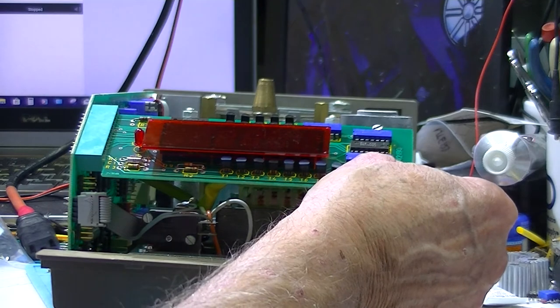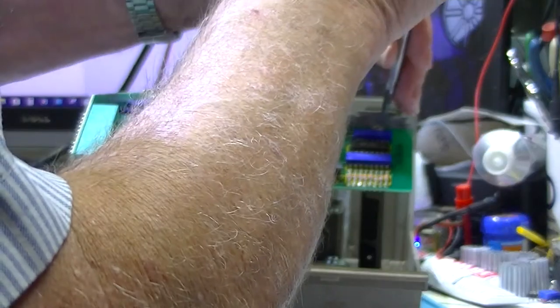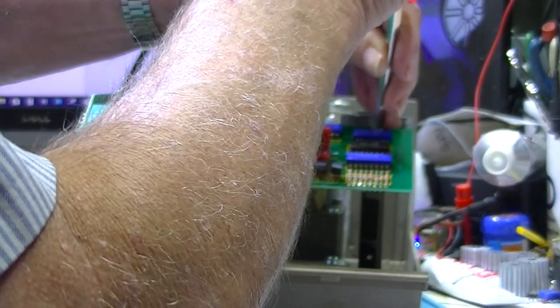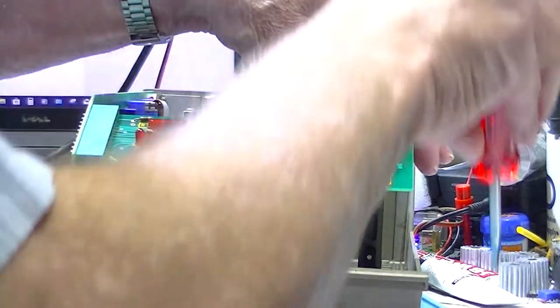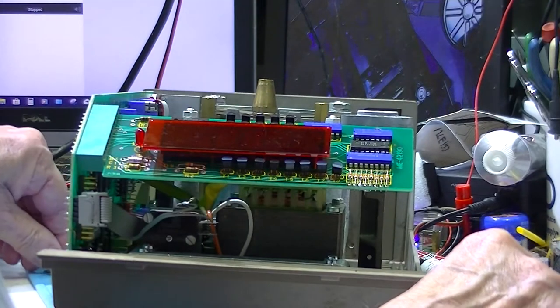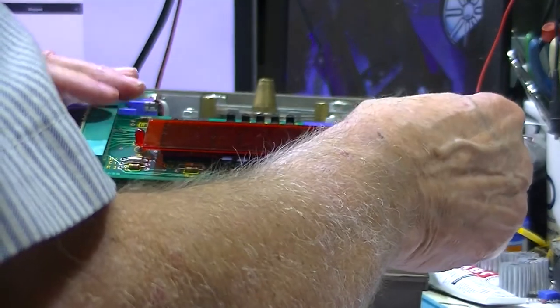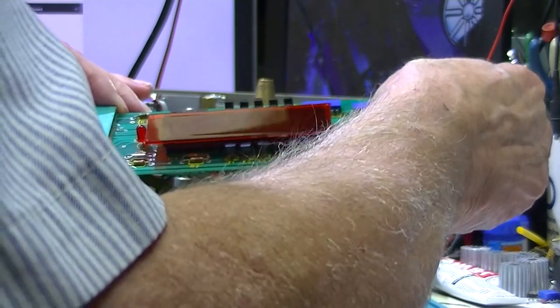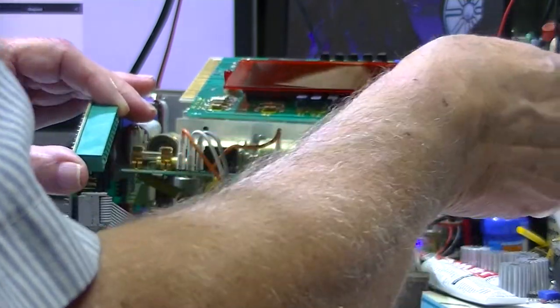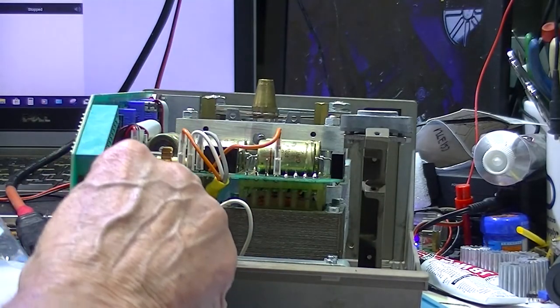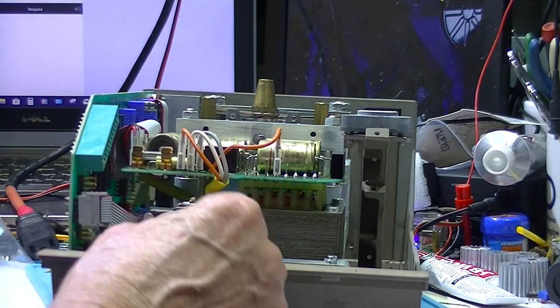I think I'll remove this display board. Now I can see the two limit switches, one above and one below.